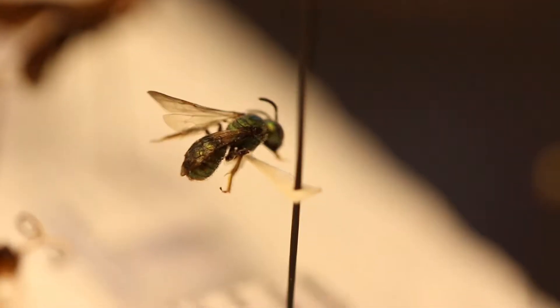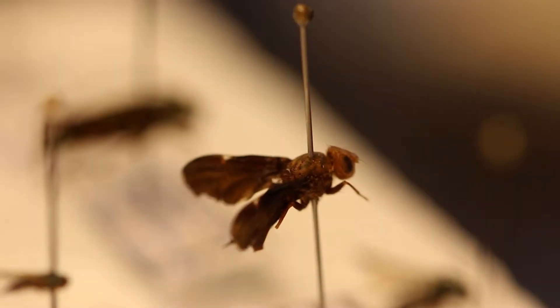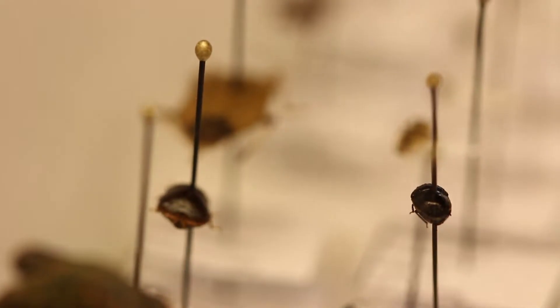Hello, my name is Liu. I'm a PhD candidate studying mosquitoes at the Ohio State University. Today I'd like to talk a little bit about making insect specimens. It's really important to keep insect specimens so that we can look at their features and identify what kind of species they are.